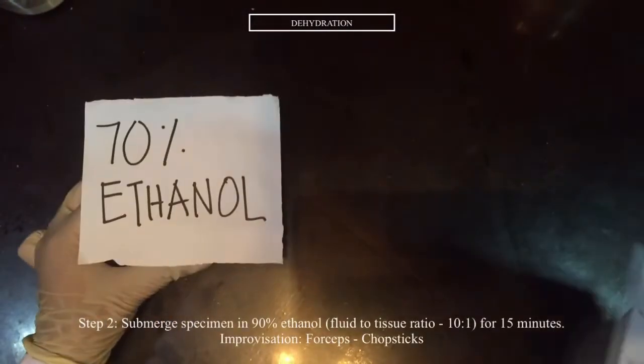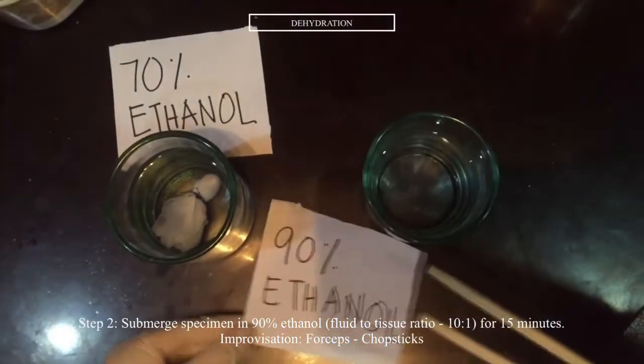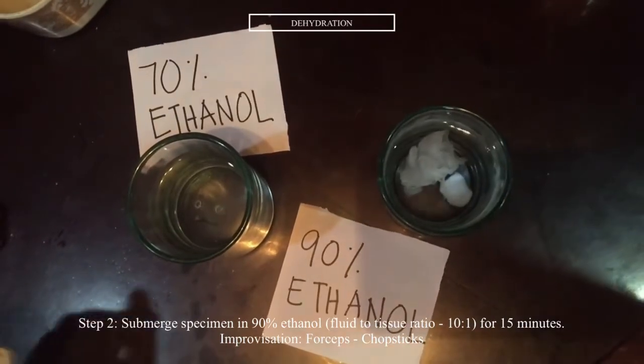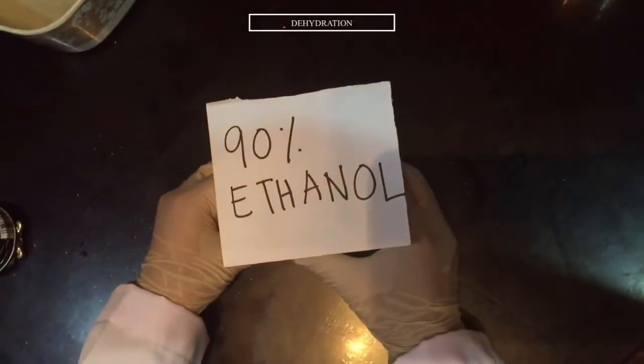Now step 2, after 15 minutes, we submerge our sample in a higher concentration, which is the 90% ethanol. Oh, and since I don't have any forceps at home, to improvise, I use chopsticks. Okay, so this tissue is being submerged for 15 minutes in 90% ethanol.